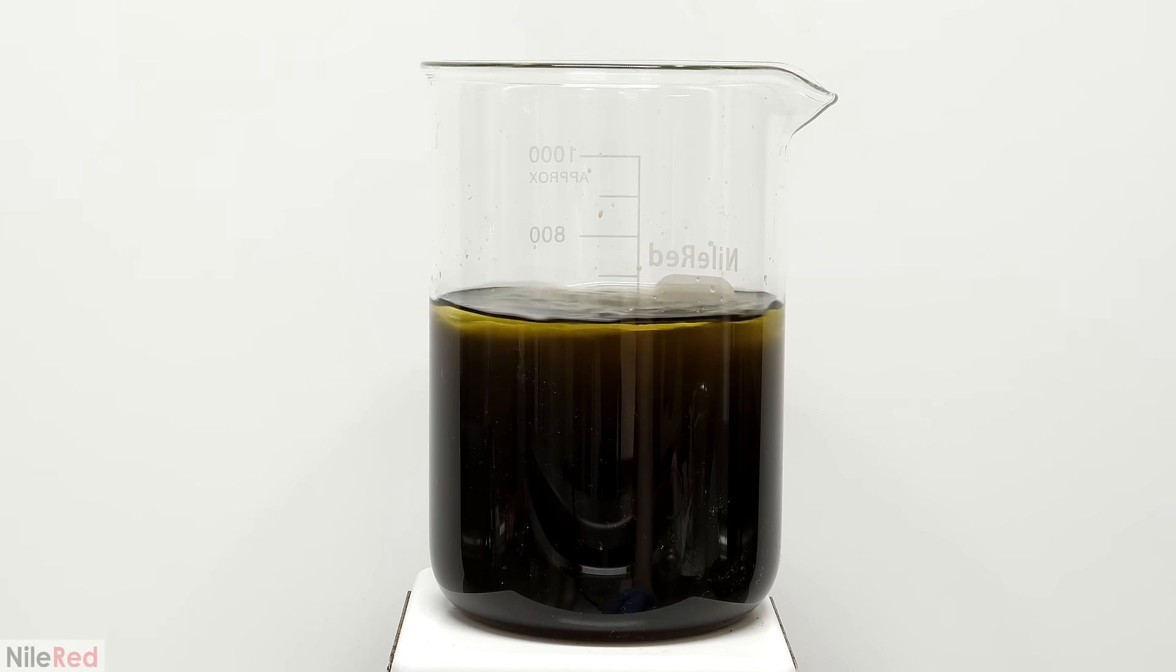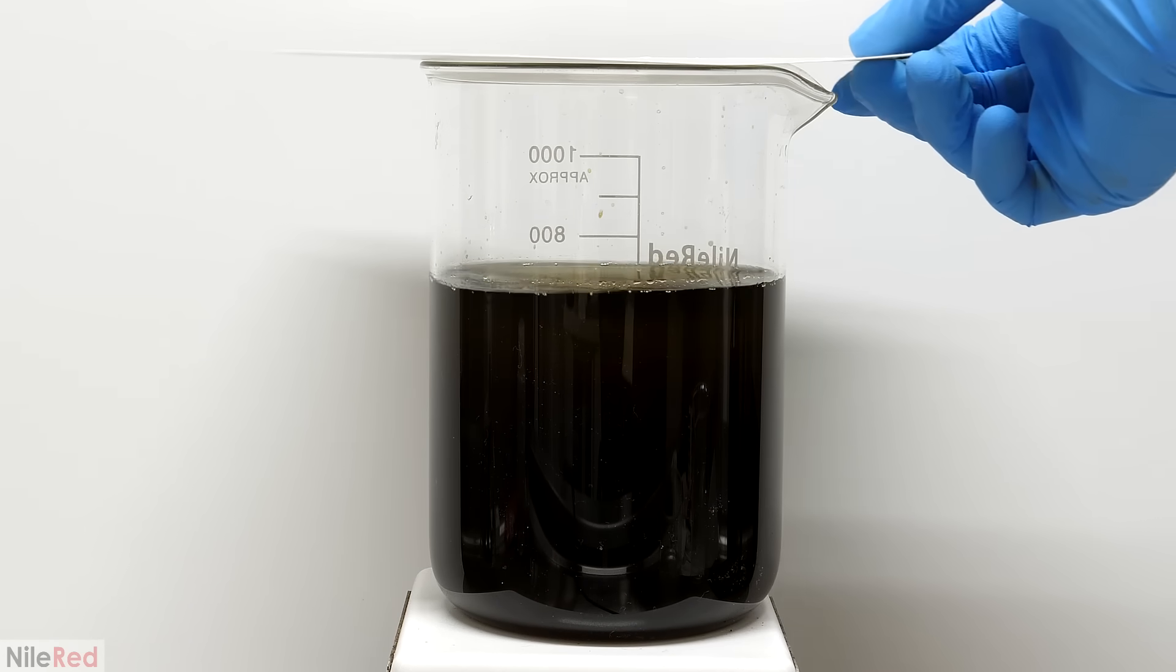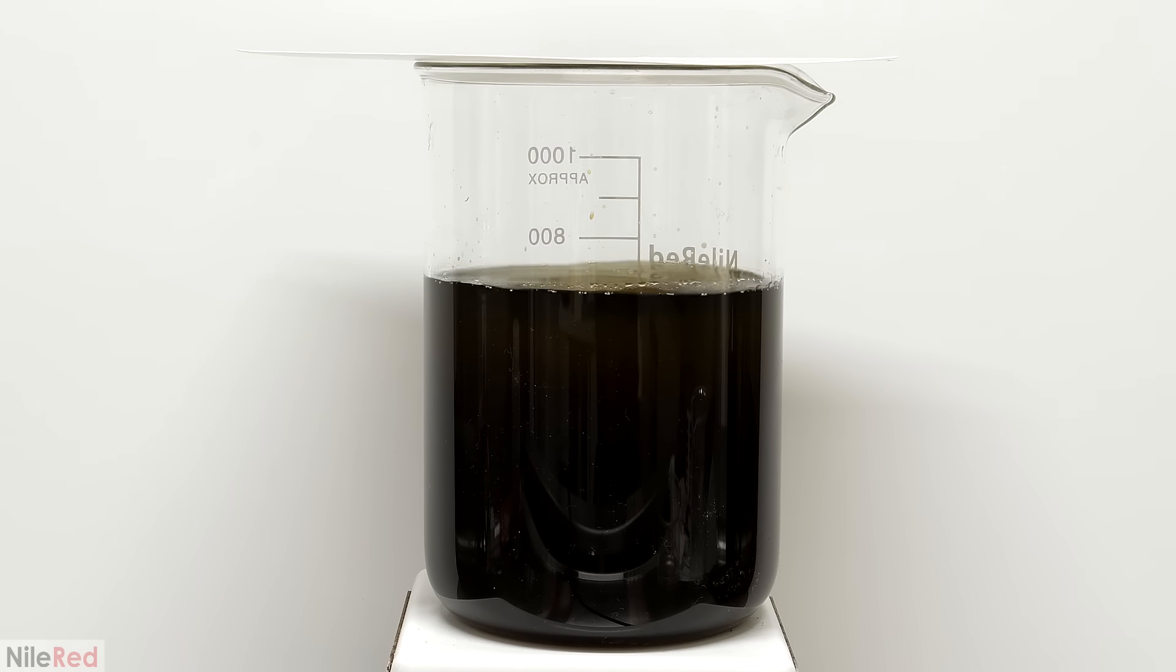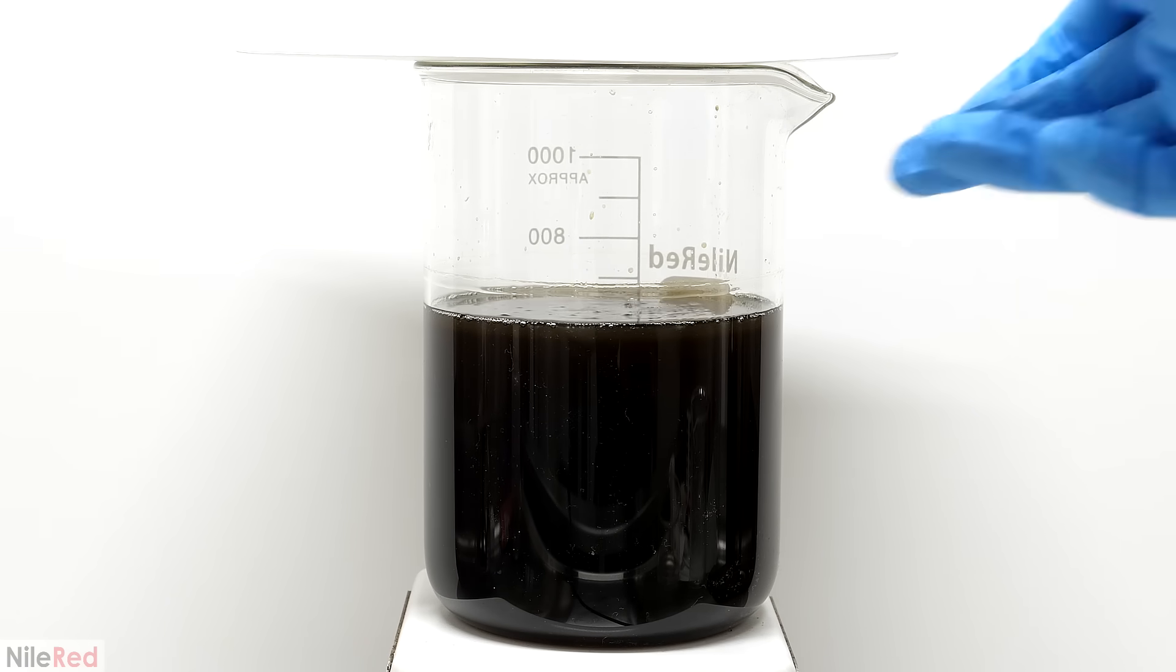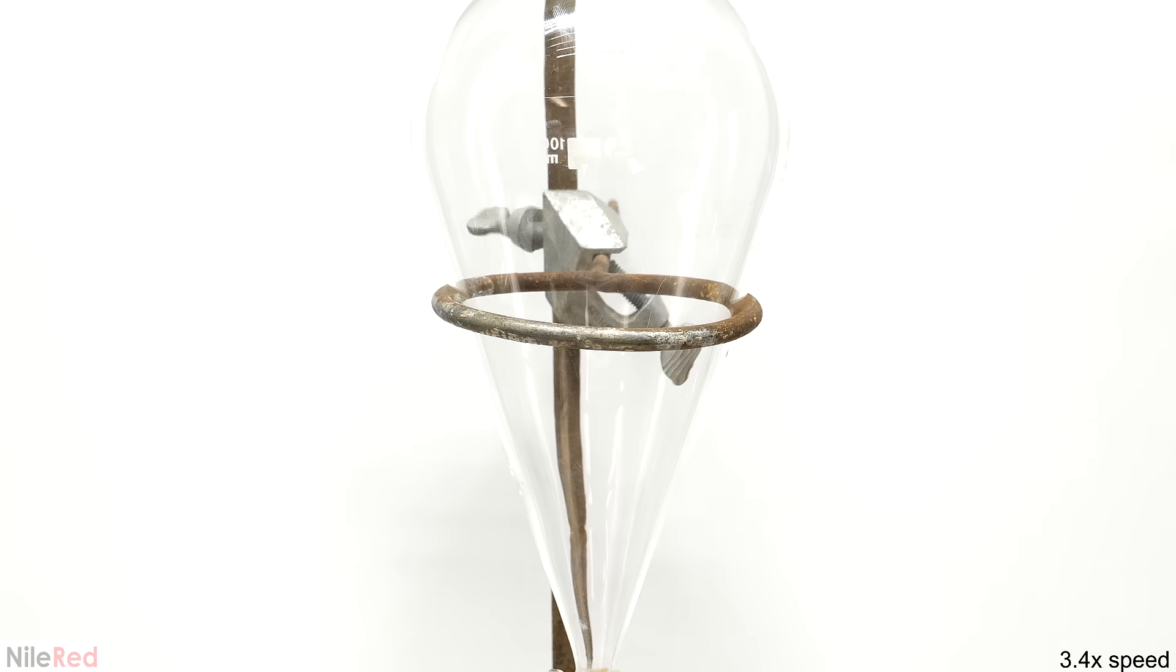What I was doing here was a solvent extraction, where the desired product was getting dissolved into the ether. Most of the other junk, like sodium sulfate, sodium nitrate, and other side products should stay dissolved in the water. The reason why the temperature had to be low for this, was because diethyl ether has a very low boiling point, and it's extremely volatile. I needed to let this stir for about 20 minutes, and if the solution were hot, all my ether would have just boiled away.